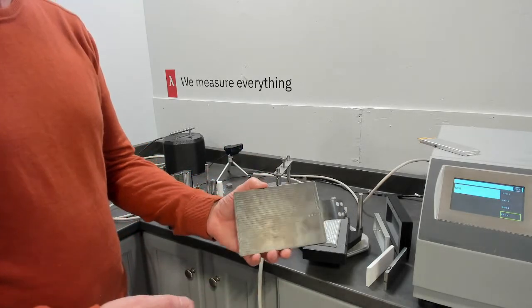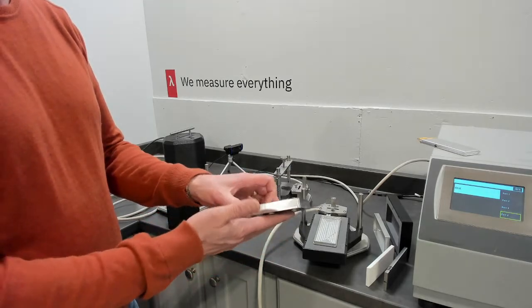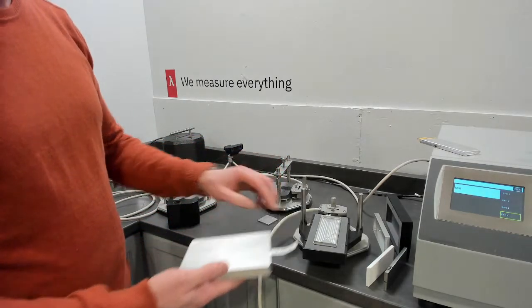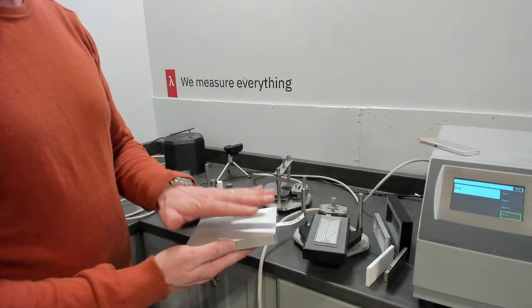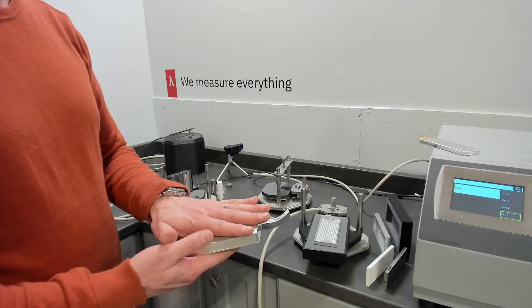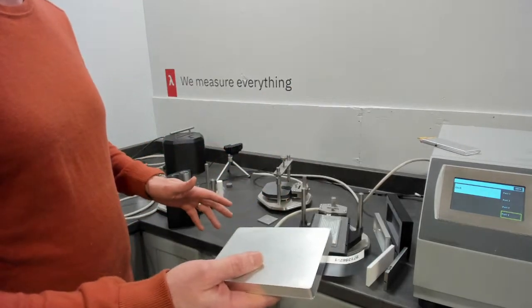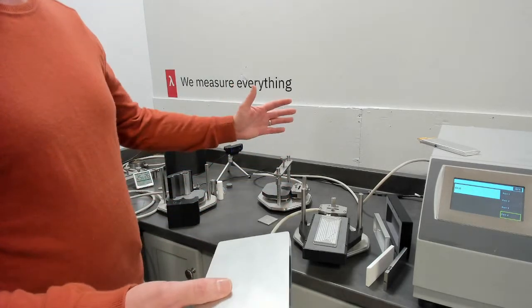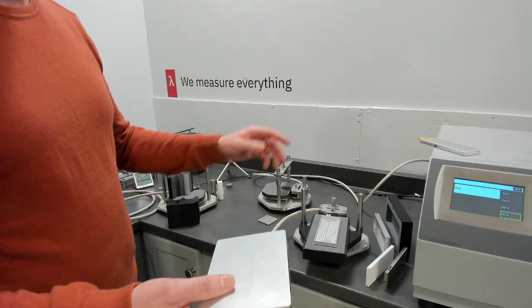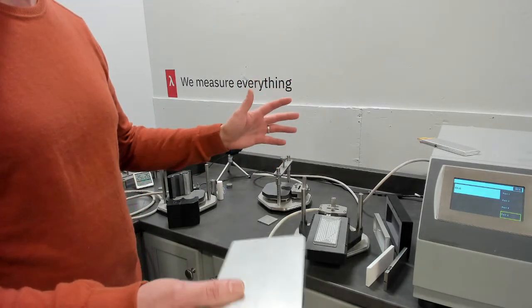And if we look underneath it, we have a sensor that's been designed to cover the entire bottom of the specific heat cell. And then we insulate it during our measurement. I'll show you that setup. We can make these specific heat cells up to 250 millimeters wide and much longer. So the length of the cell is based off of the length of your pouch. So we try to match it up as best we can.